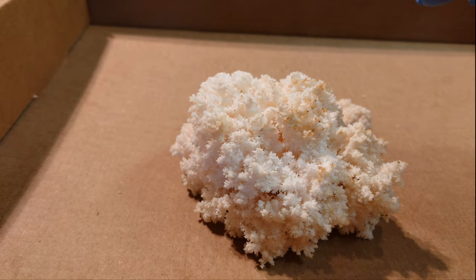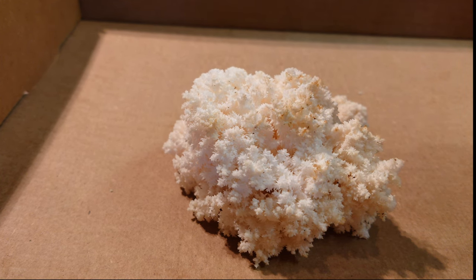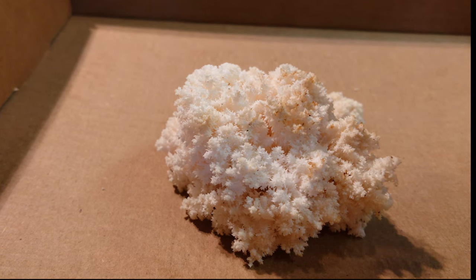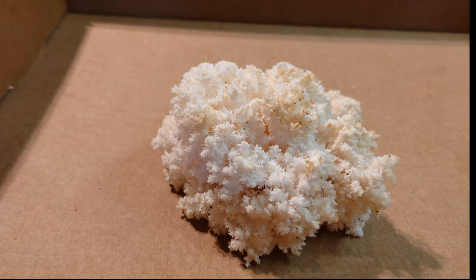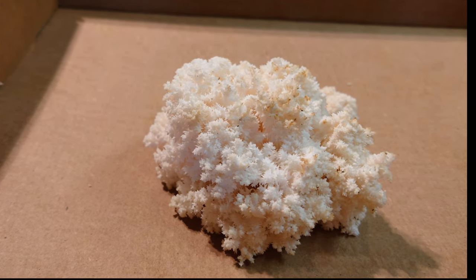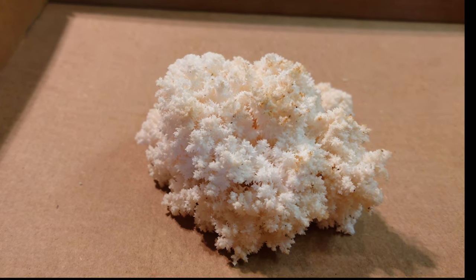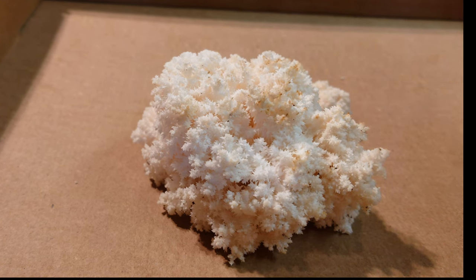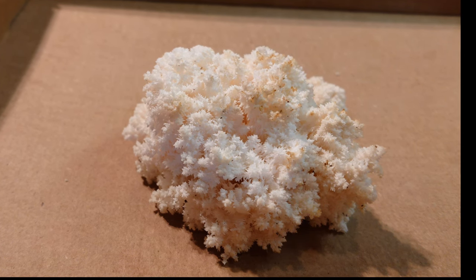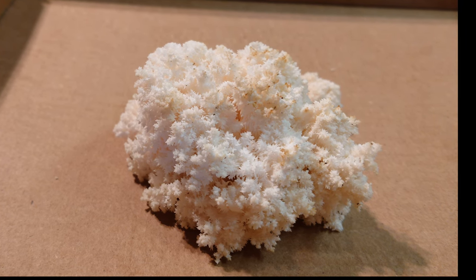You do want to keep the fruit body downwind of your other equipment on the flow hood table. This fruit body is far from sterile - there's bacteria and weed fungi spores on the surface because it's been out in the woods exposed to open air. Keep it downwind of your plates and other equipment. When you transfer, transfer upwind into the more sterile air right in front of the HEPA filter onto your petri plates. We're going to do four plates with four different little pieces of tissue, and hopefully we'll get some nice sterile mycelium running across the plate.